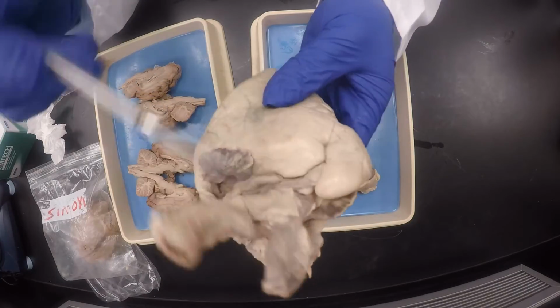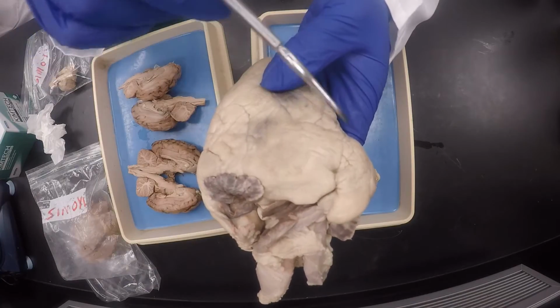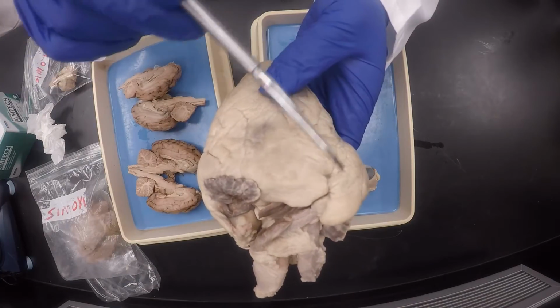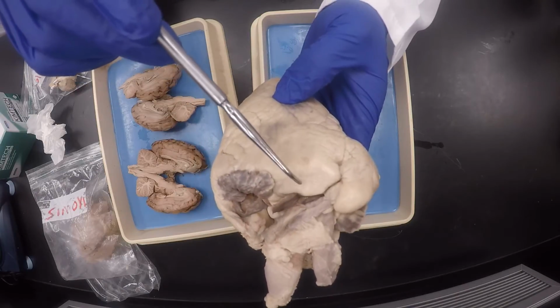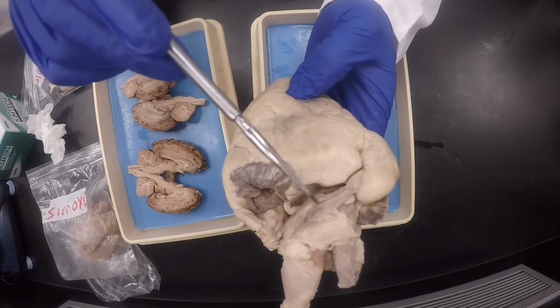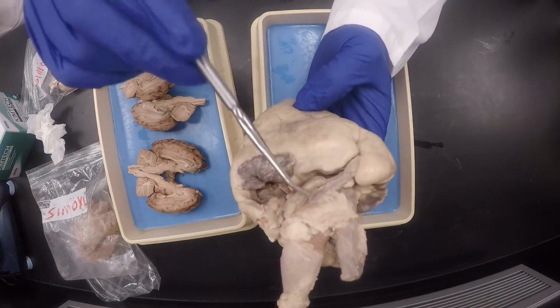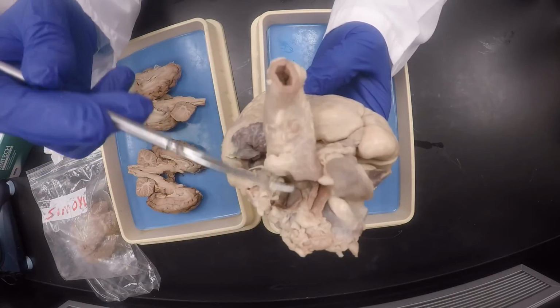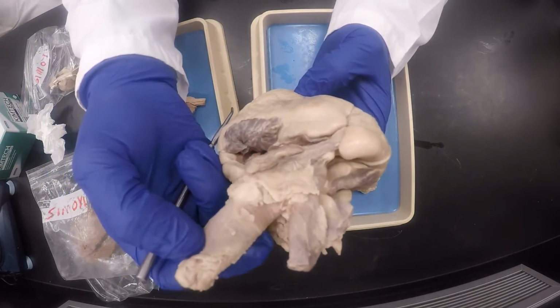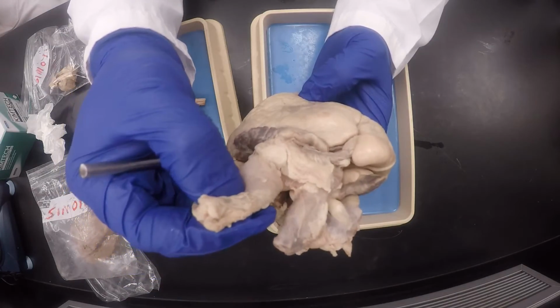All right, and I said to confirm that this is the anterior side, once you locate your interventricular groove or interventricular sulcus, you will see the pulmonary trunk right in front of you. You can't miss it. Okay, so that confirms that indeed this is the anterior side. Pulmonary trunk, which is one of the four great vessels, the aorta right here, which we just talked about, is an elastic artery. You see how elastic it is? I can even press it like a trampoline.